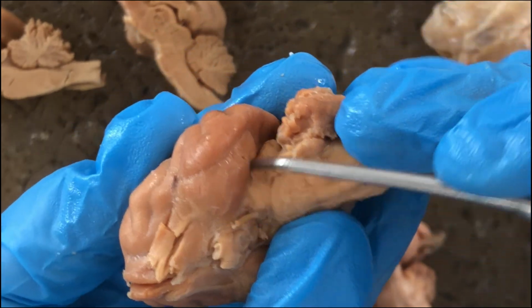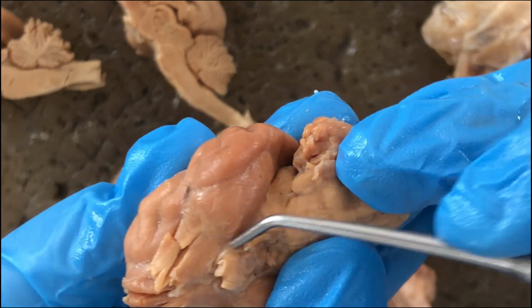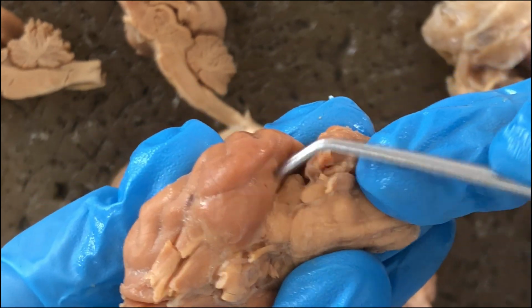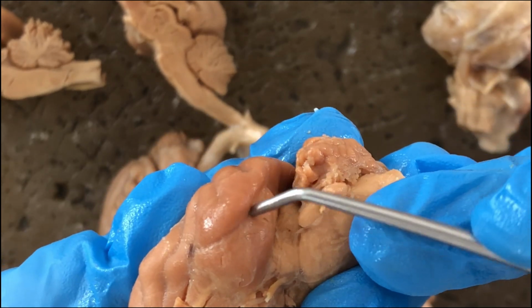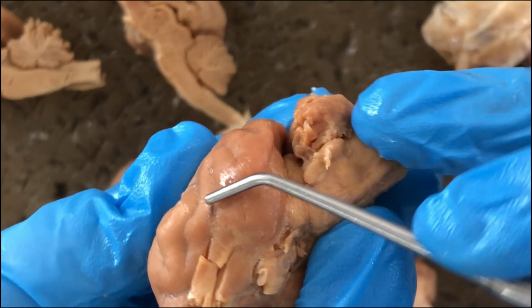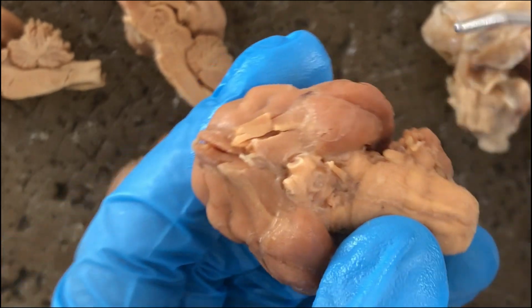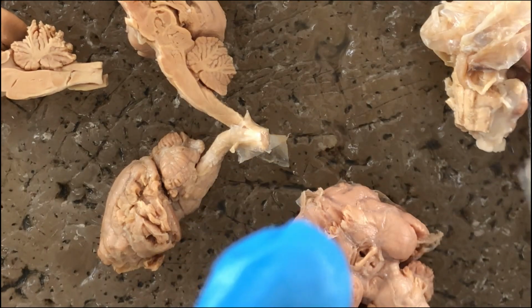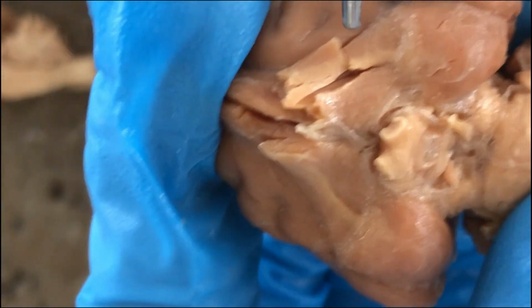There's a special portion of the cerebral hemisphere that processes olfactory information, smell information. And that groove that delineates the piriform lobe from the rest of the cerebral hemisphere would be the rhinal fissure. Alright, so that would be the olfactory system.